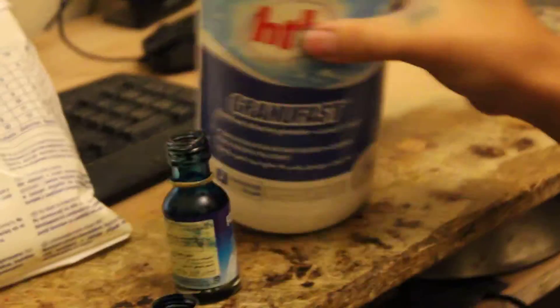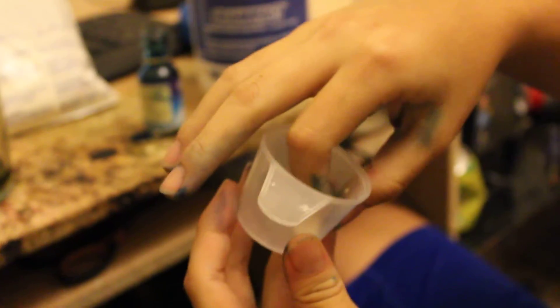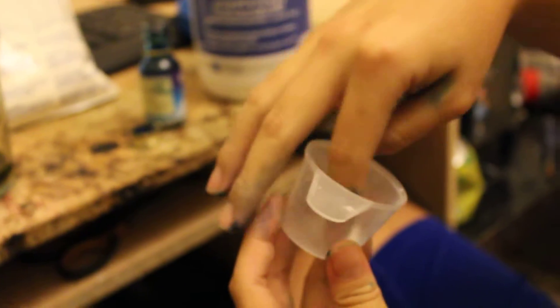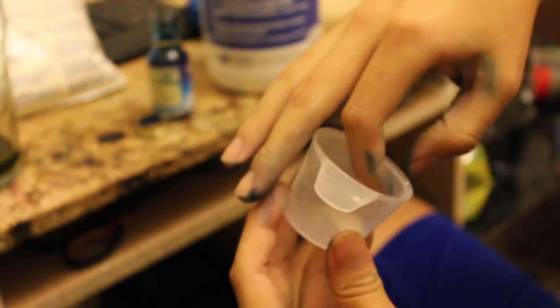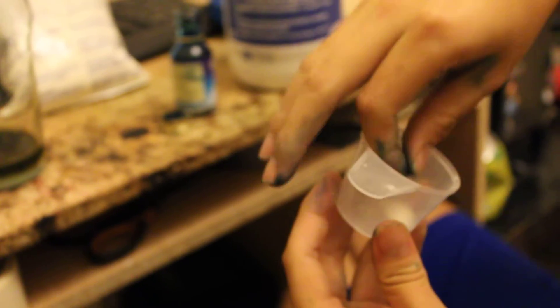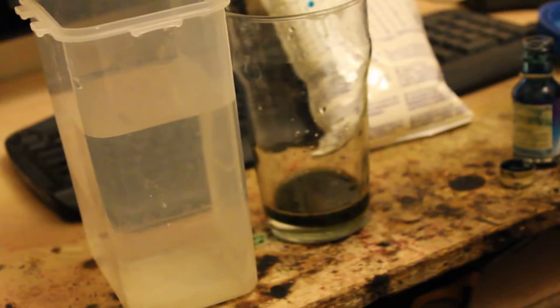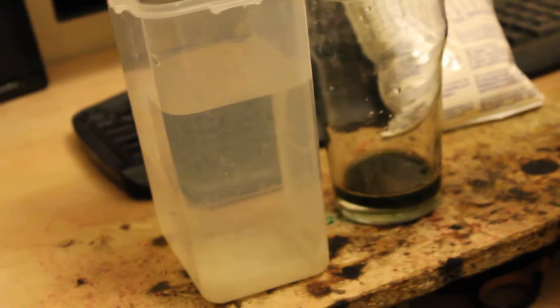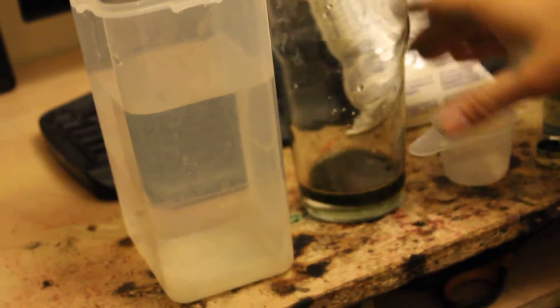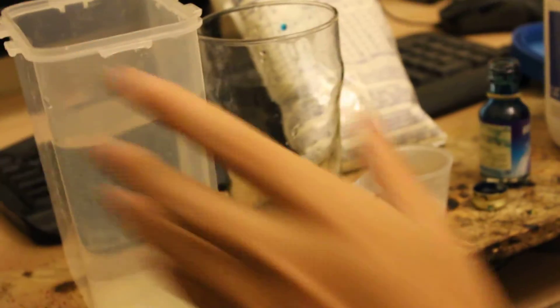Now you're wondering just how sensitive is this indicator. Well, I'm gonna show you just how sensitive it is. Here we have a little bit of our sodium dichloro isocyanurate. Now this is drinking water, by the way. This water has no chlorine in it. So I add just literally a few drops of this substance. You can see there's only very, very little chlorine in this.